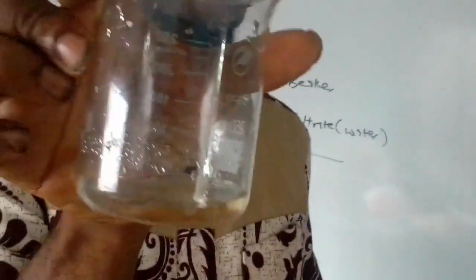So on the table, this is the zinc carbonate, which is called the residue. While the liquid here is called the filtrate. Residue and filtrate. So as you can observe, you see the residue, and you also have the filtrate collected. Okay. So sometimes you may refilter. If the filtrate is not clear enough, you may refilter the filtrate so that you have a good separation.